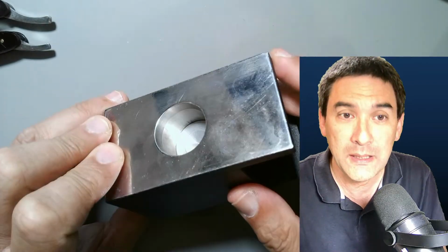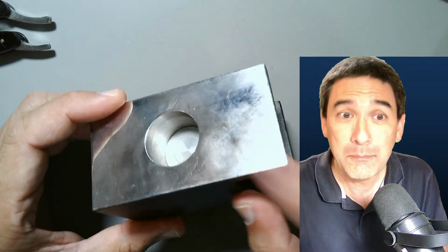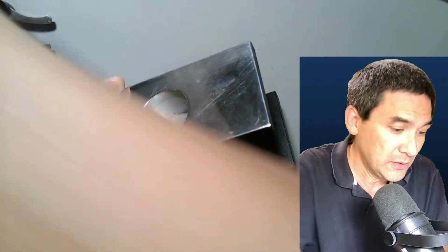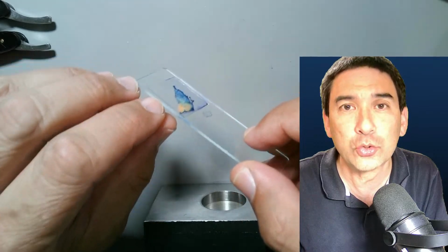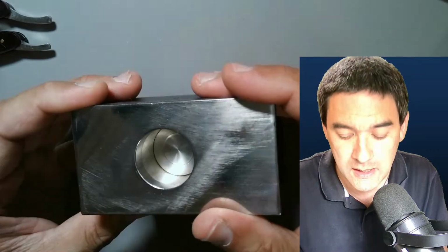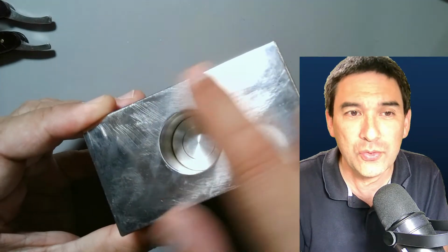I will talk about this a little bit in a second, and how it's similar and different to the other microtomes that I have. And if you're completely new to this whole topic, because sometimes there are also beginners watching, microtomes are used to make slides. I just want to show you, I've got over here a slide. This is a carrot, and I stained it in blue to make very, very thin cross sections, and this one specifically of plant material. So that's basically the one that I've been using. You can see that I've been already using it today quite a bit.